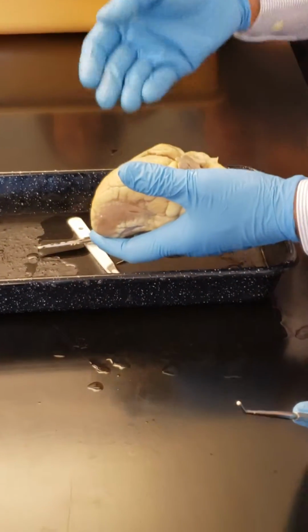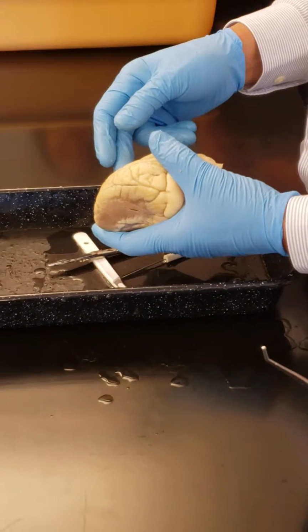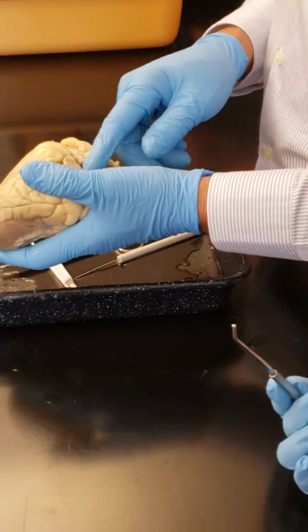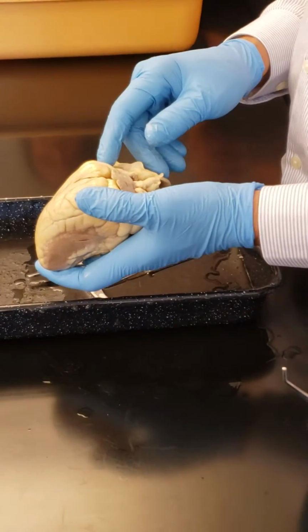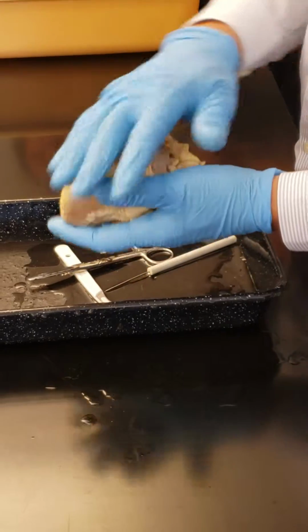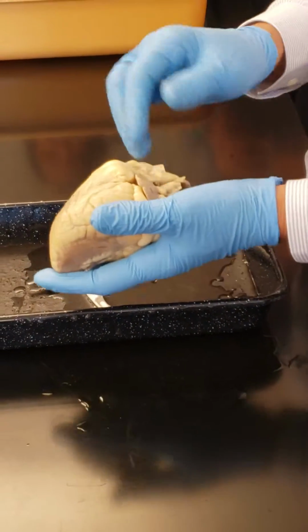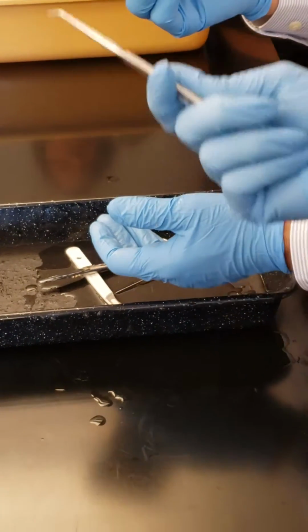So this is what you need to know about this: bicuspid valve, tricuspid valve, chordae tendineae, papillary muscle, aortic semilunar valve and the pulmonary semilunar valve. And from the surface, the chambers, the grooves, correct? Any question on this part here?